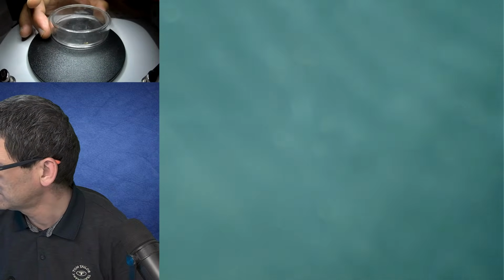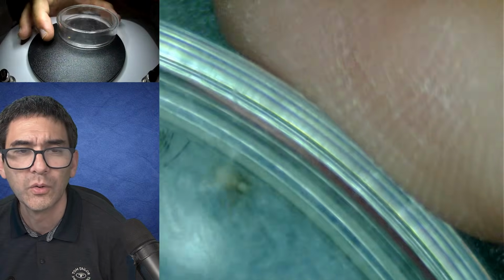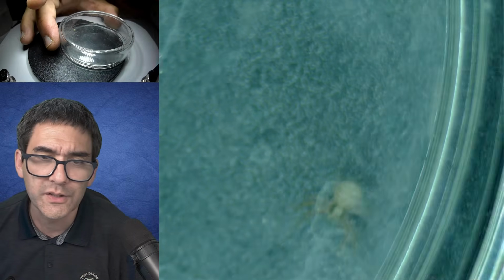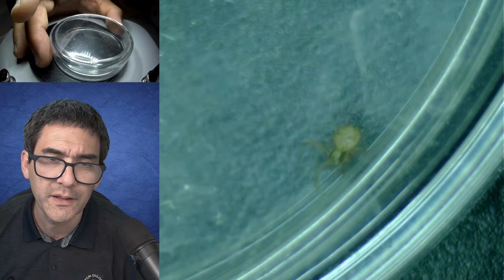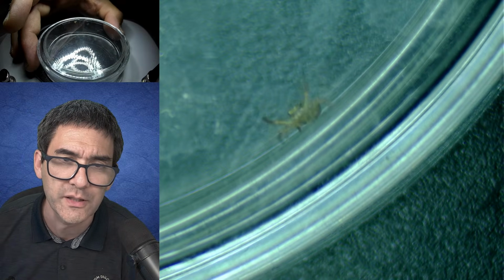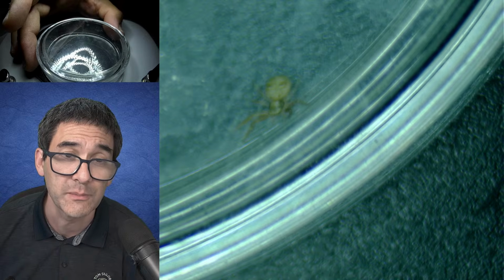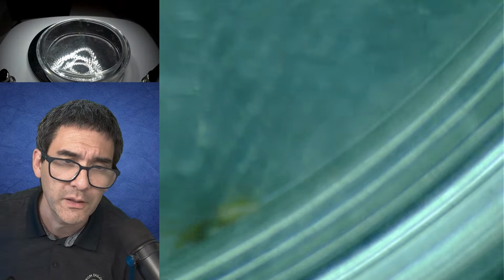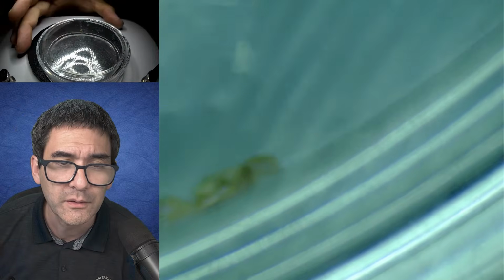Maybe I'm just also going to. Here, this one is now running. No, it's crawling up all the time. No, this one here is now over here. Yeah, so this is also something that I like to do every now and then. Sometimes I have occasional discoveries like those spiders or sometimes also insects and so on. And then I like to simply put them under the microscope and observe them a little bit.